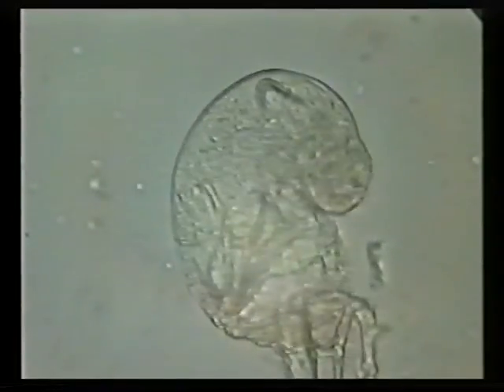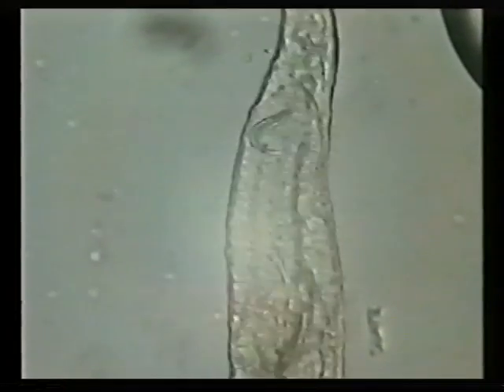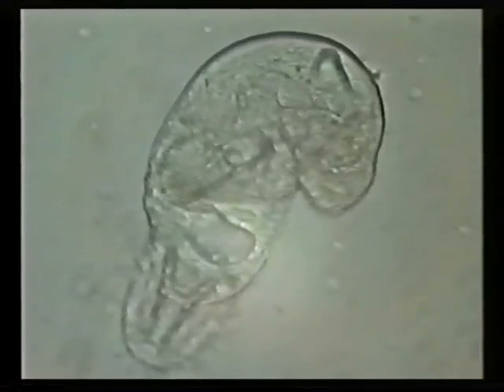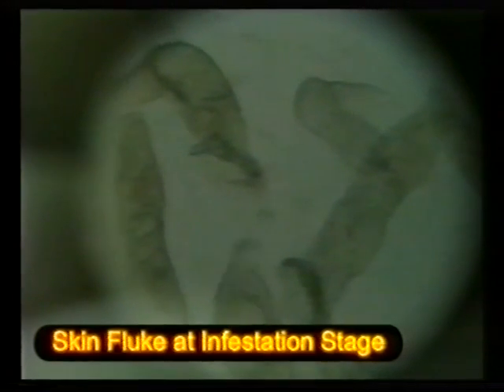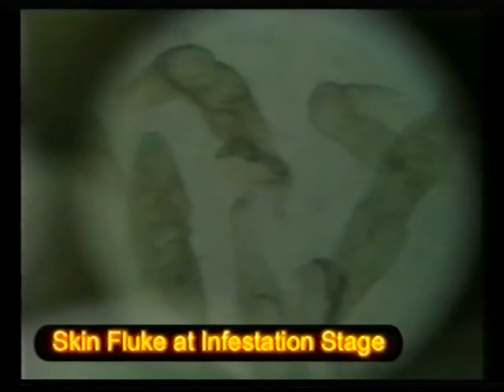Under normal conditions, healthy fish produce antibodies which are contained within their mucus. This action helps to keep the parasites under control. Only when fish become debilitated in some way will they submit to parasite infestation. At this stage, human intervention is required. Skin damaged by the vicious use of their hooks will invariably make way for secondary bacterial and fungal infections. This action can clearly be witnessed on this video.